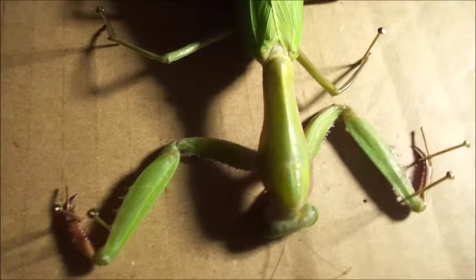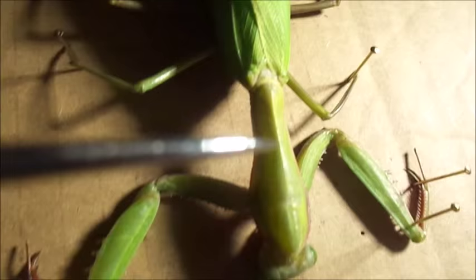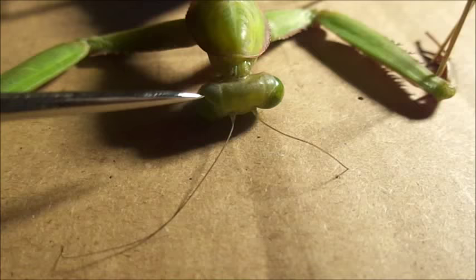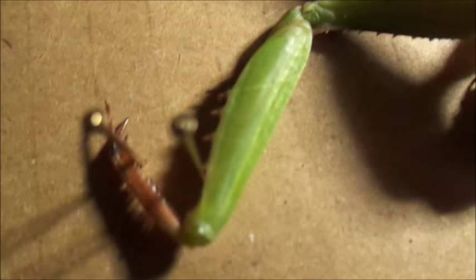The tarsi on the other legs have either been eaten by the locust she was being fed, or have fallen off with age, because she is fairly old — she's laid two oothecae to date. Moving up to the thorax and head, you might just be able to see the three simple eyes, the ocelli, and two large compound eyes. These are the front arms — the raptorial appendages — wickedly spiked for grabbing hold of prey and keeping hold of them while they struggle and are eaten.